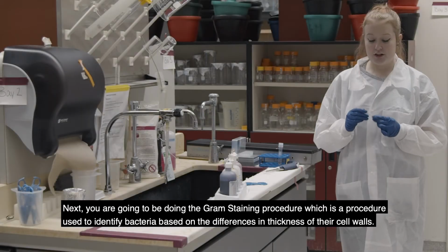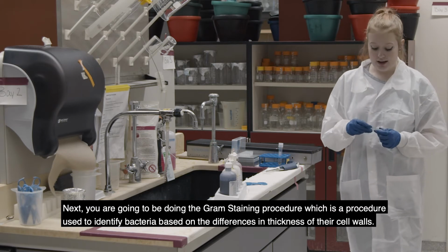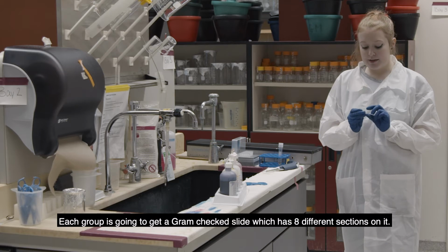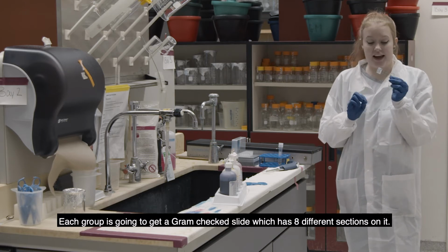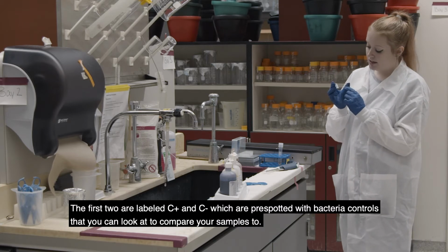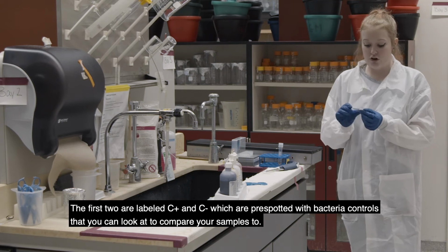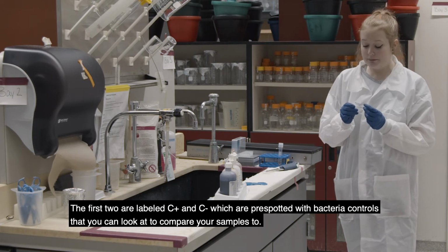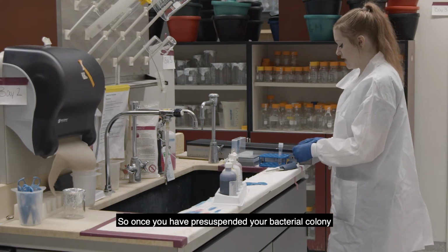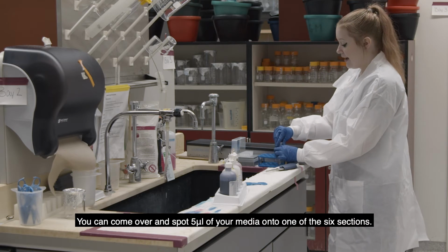So next you're going to be doing the gram staining procedure, which is a procedure used to identify bacteria based on the differences in thickness of their cell walls. Each group is going to get a gram check slide, which has 8 different sections on it, and the first 2 are labeled C+ and C-, which are pre-spotted with bacteria controls that you can look at to compare your samples to.